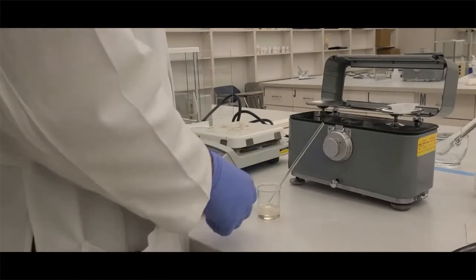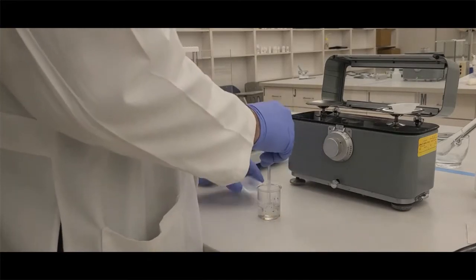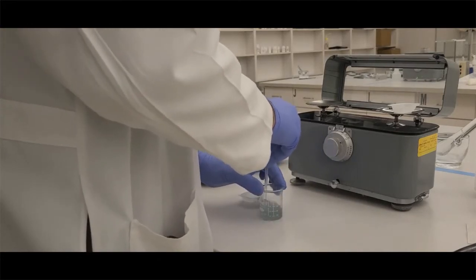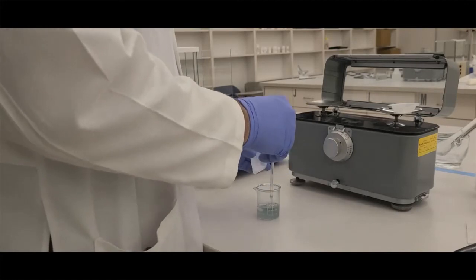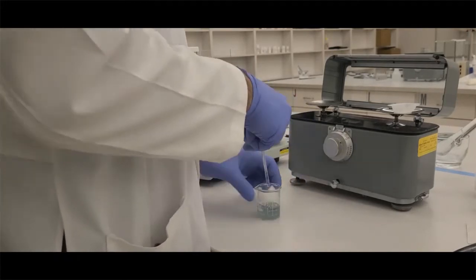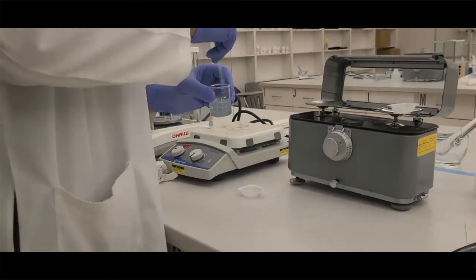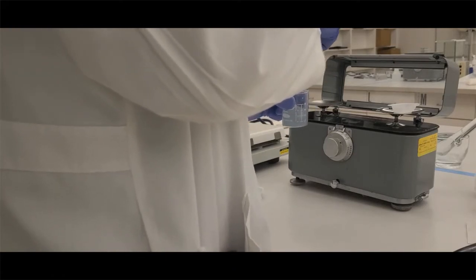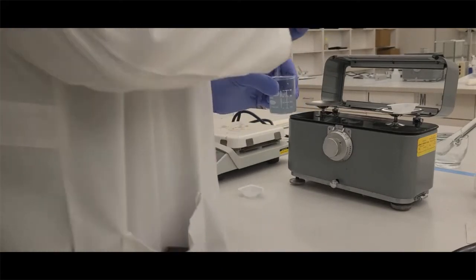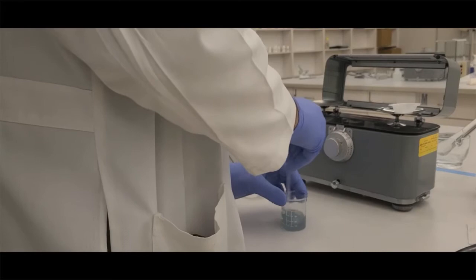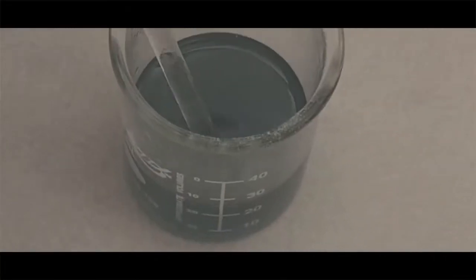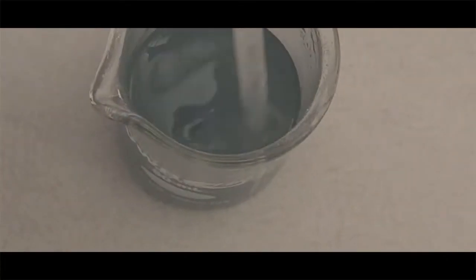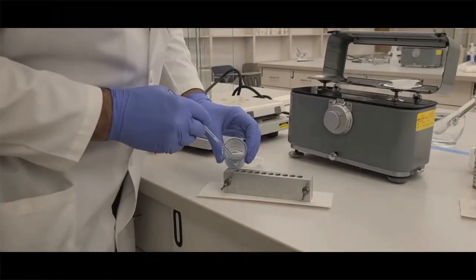This is a fatty base, so we usually don't use that much lubricant as long as the mold has completely solidified. It'll pop out very easily. If you don't let it solidify, you're going to have a big problem getting them out. We're going to put it on top of a paper towel again. We have our base that's melted. I'm going to incorporate my drug. I want to make sure I don't have any pieces of really big, chunky powder. In this case, we're using a blue-colored powder so you can see the particles. You want a uniform-looking suspension.